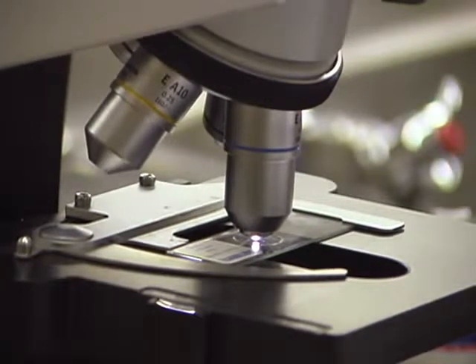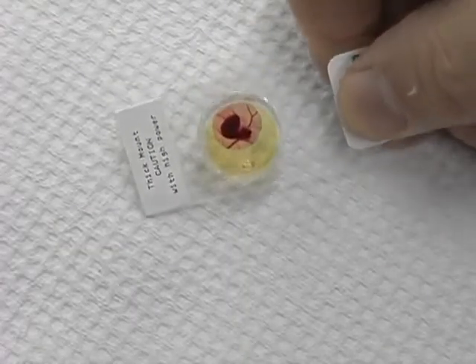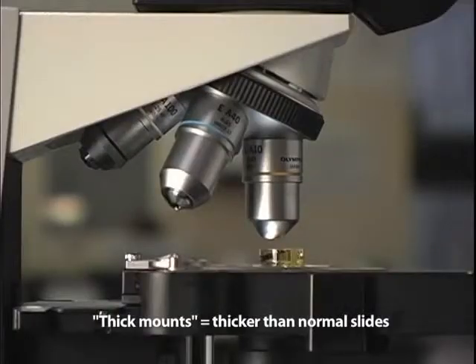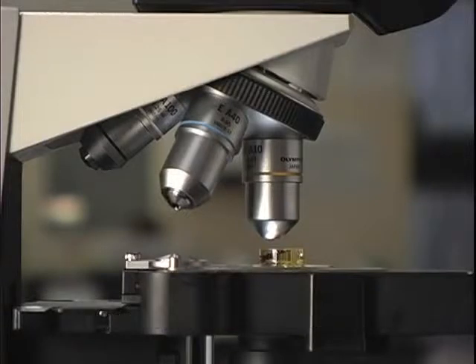Today's microscopes are usually designed so that the highest objective lenses cannot break regular slides. However, at higher magnifications, it is possible to break thicker slides. Such slides are usually called thick mounts. When using higher magnifications with such slides, focus the object by starting with the objective lens close to the slide and then move the lens away from the object.